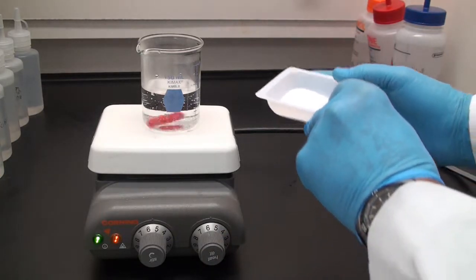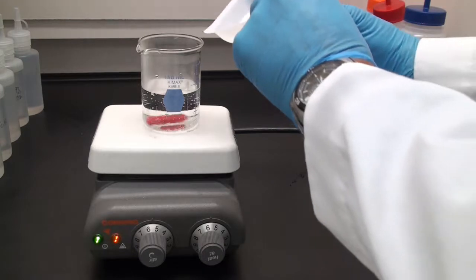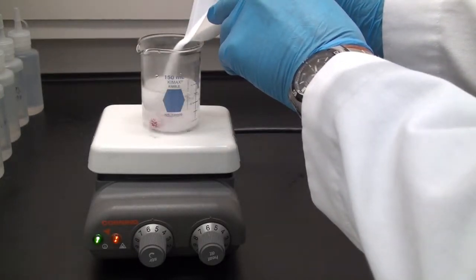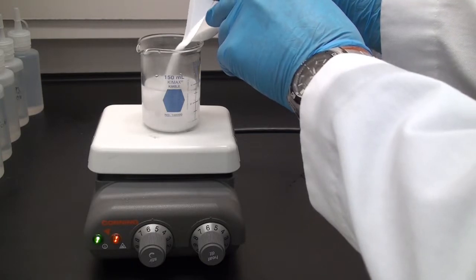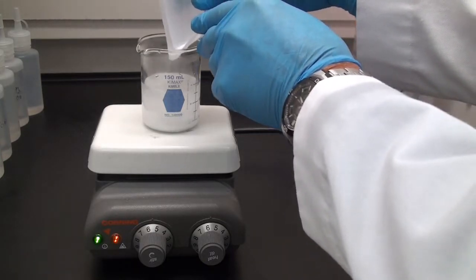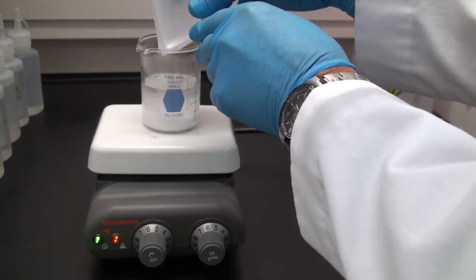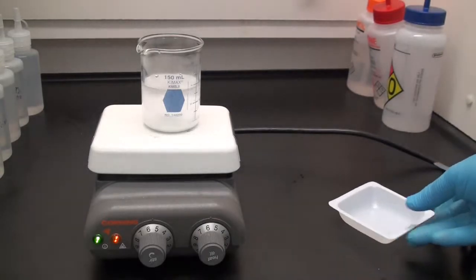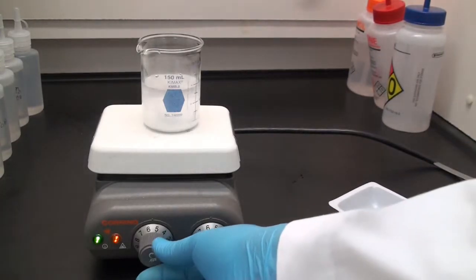And I dump that in. Don't have to be too careful, but again I don't have the fume hood on to avoid any dispersal of my solids. We can see that that goes cloudy. It doesn't go into solution very well, but we're going to take care of that in just a little bit.